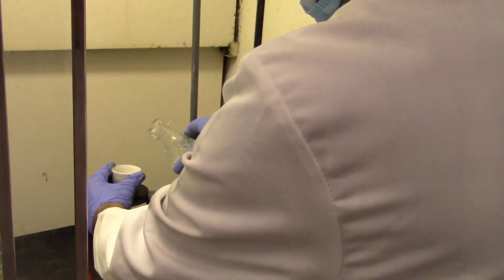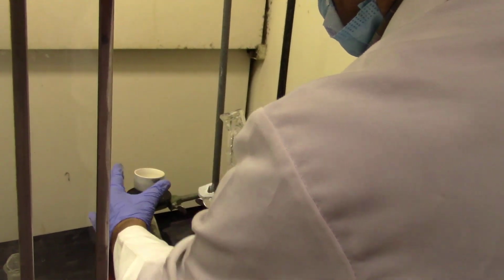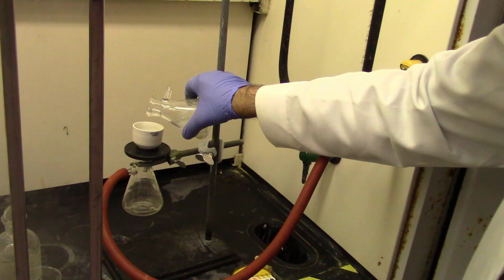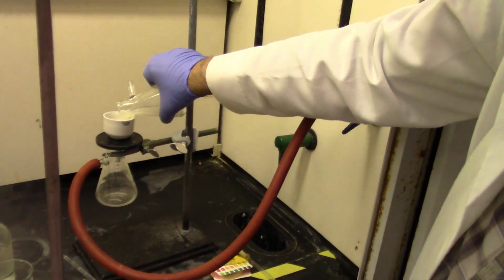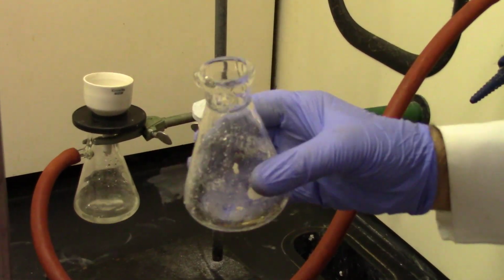After chilling in a cold ice water mixture, I get more precipitate, and now I'm ready to vacuum filter. So when you turn on the vacuum, I'm going to pour it onto the Buchner funnel, which is fitted with the filter paper. That filter paper, by the way, is part of the mass with the watch glass. So I'm filtering. I've already transferred most of it.